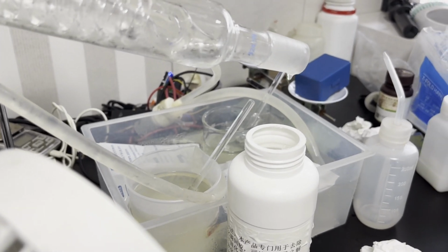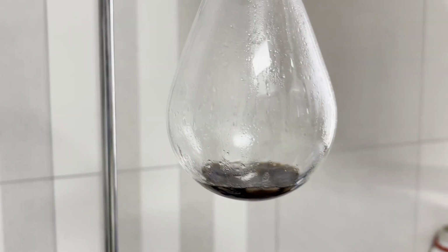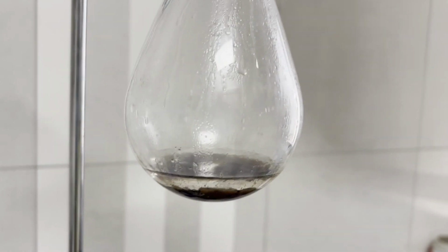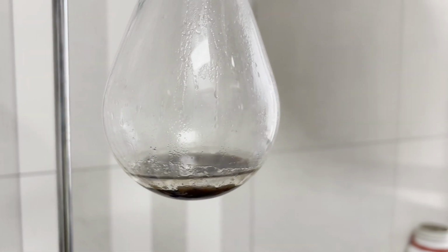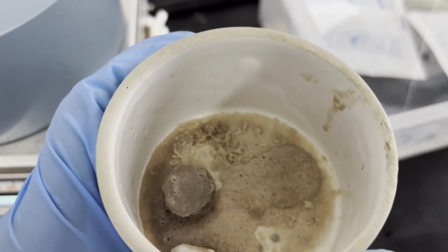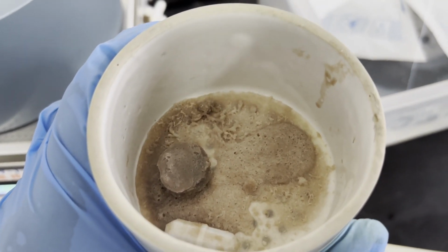Since p-bromophenol has a relatively large vapor pressure, the flask is not touching the heating mantle to limit the temperature and prevent overheating, but I think I still overheated a little and the product looked like tar. I added some water and stirred it around, and fortunately the tar crystallized into dirty brown crystals. The mixture is filtered on a funnel, and some light brown solid is left behind, which should be our product, p-bromophenol. Although grossly impure, I'm still happy that I had some yield, since I used self-made bromine that likely contained water, and didn't calculate the amount of bromine to be exactly 1 molar equivalent.